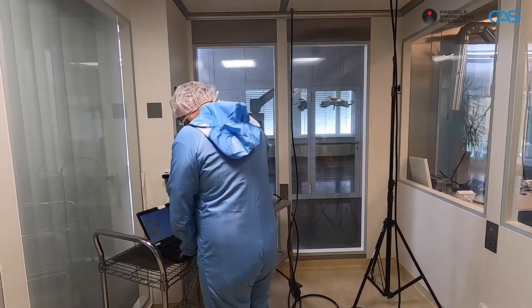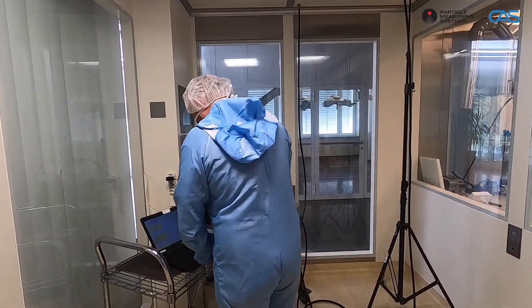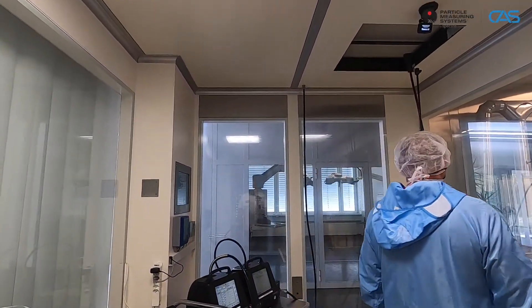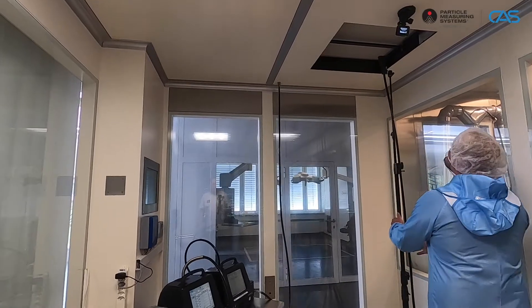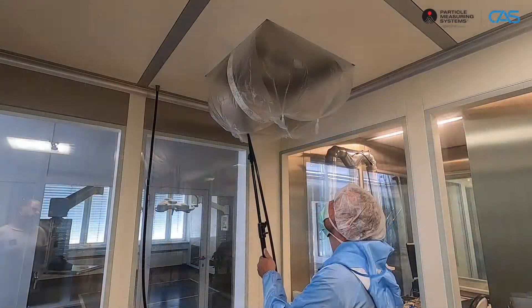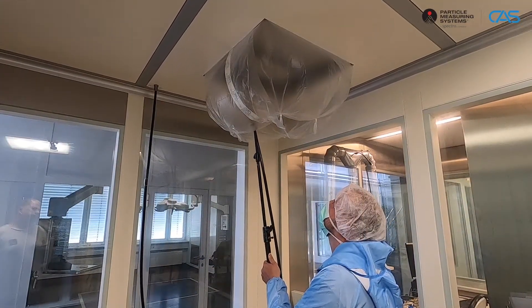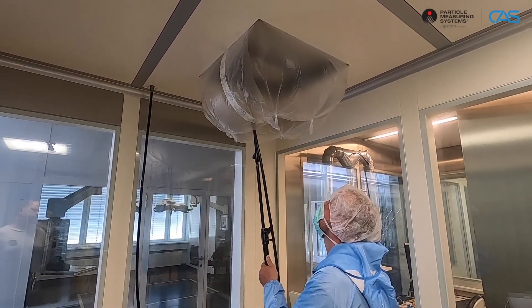Before we start with the filter integrity test, the filter system is equipped with an apron. This prevents foreign particles from the environment from falsifying the measurement.